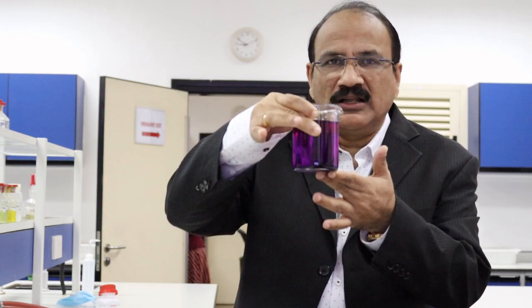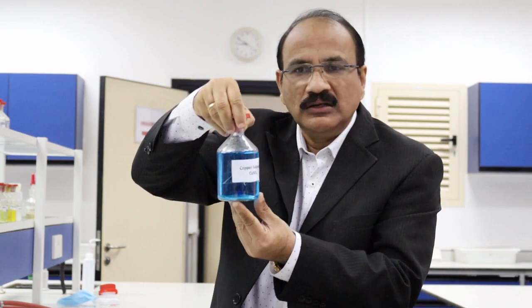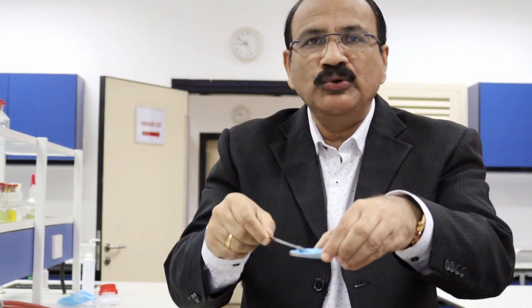I have potassium permanganate which is purple in color. I have potassium chromate which is yellow in color. I have copper sulfate solution which is blue in color. I have the original copper sulfate salt which is also blue in color.